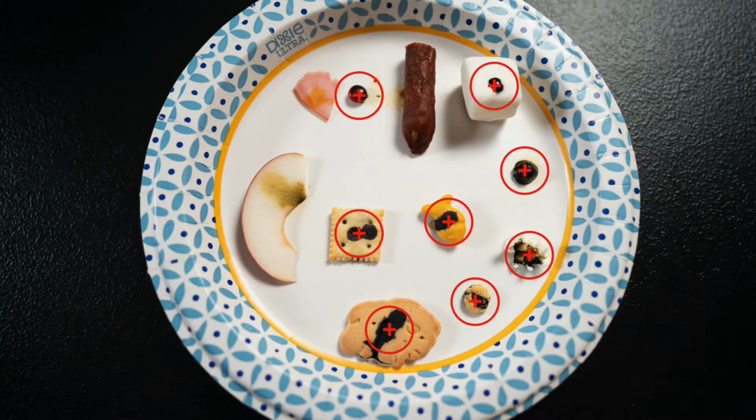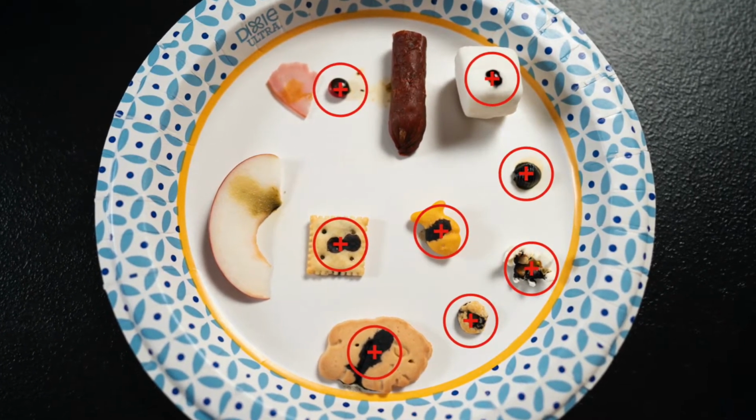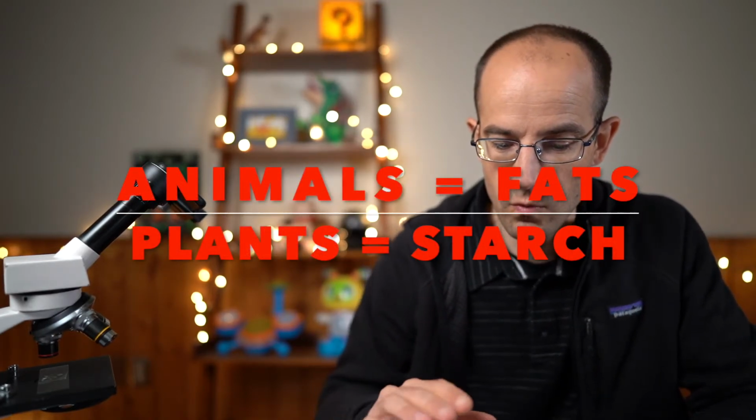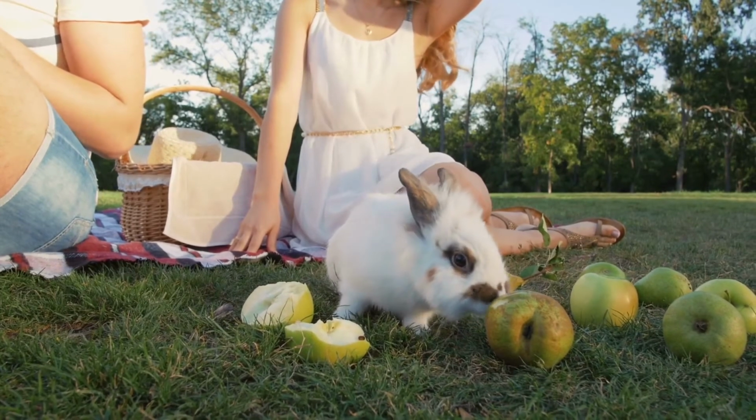And then on the other side, plants store their energy in starches. Those are the general trends that we see. One of the interesting ones is the apple. The apple does not show a positive starch test because the apple really isn't meant to be stored food for the plant. The apple is meant to be eaten by an animal, and being a sugary type of thing makes it more appealing, easier to digest for the animal.